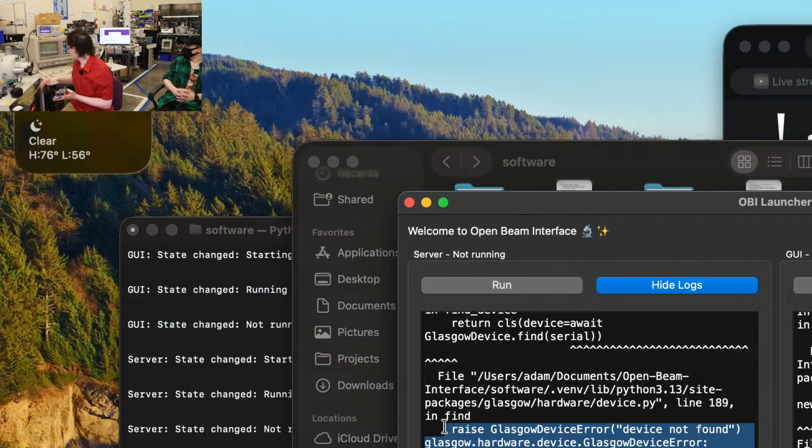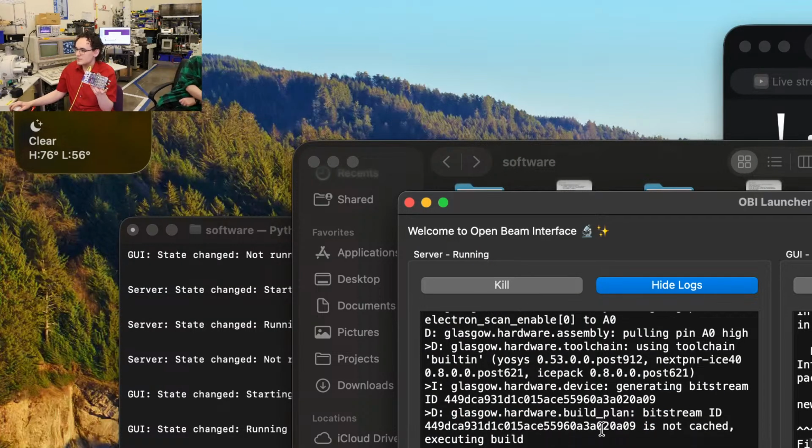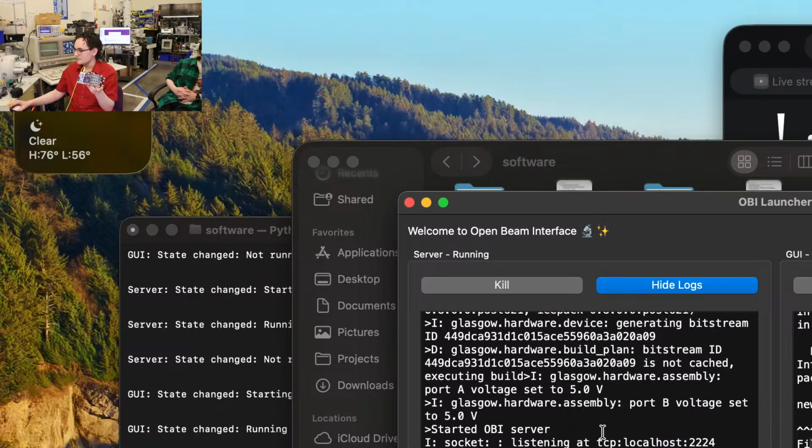So we go ahead and take our USB-C cable here and plug that into Glasgow here. We got some very pretty lights now. And we can go ahead and run the server again. And now it's building the bitstream. So that's the bitstream it's going to configure the FPGA with. It checks if the bitstream is cached. The bitstream is not cached because this is our first time we've run Glasgow.